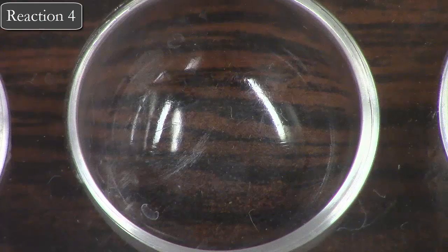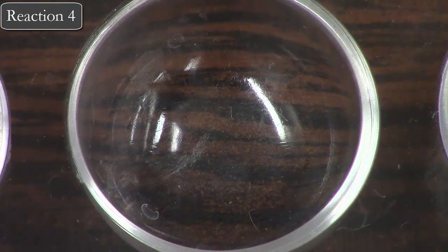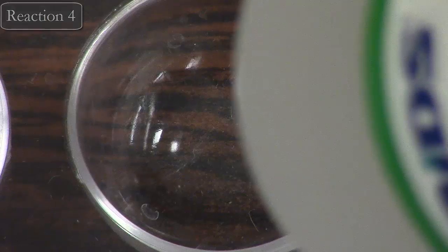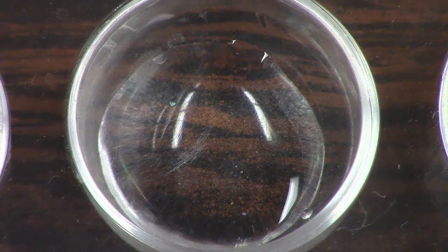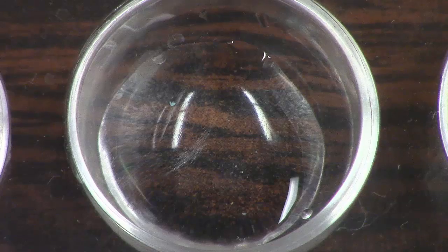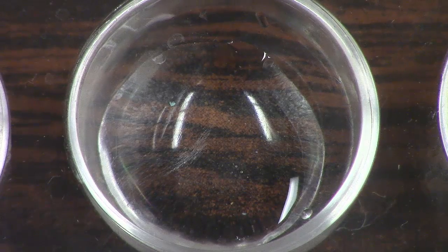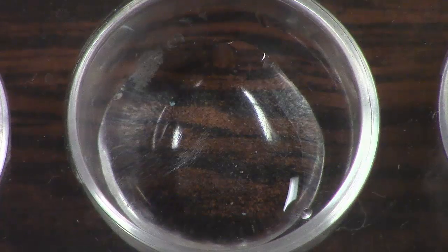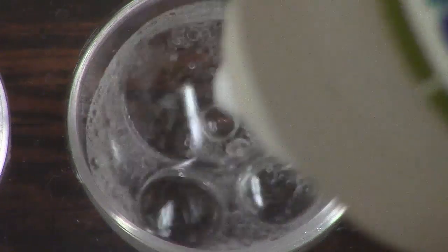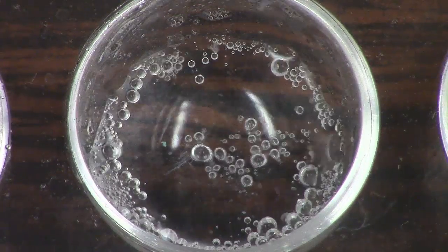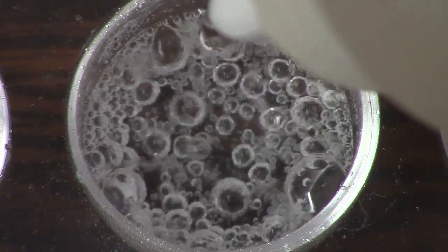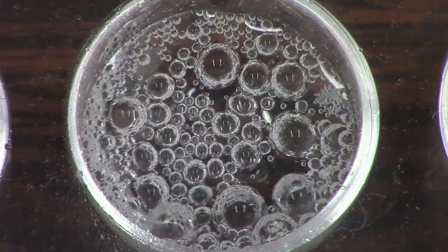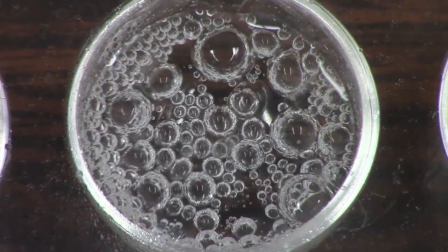In this next well, I'm going to place some sodium carbonate—a couple drops—and I'm also going to add some hydrochloric acid. You can see instantly we get a nice reaction there. Try to predict what gas is forming.